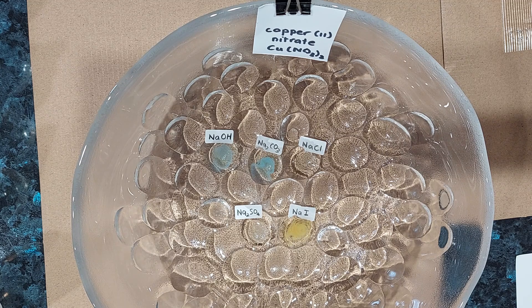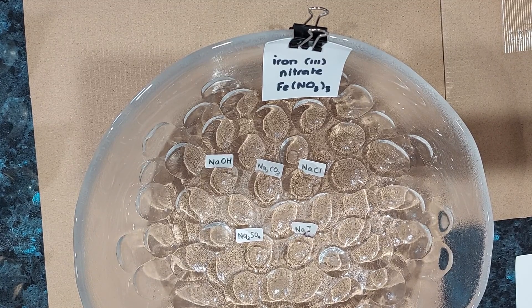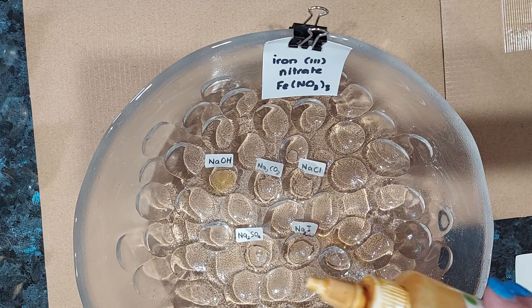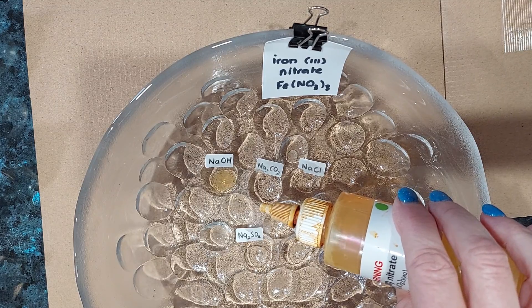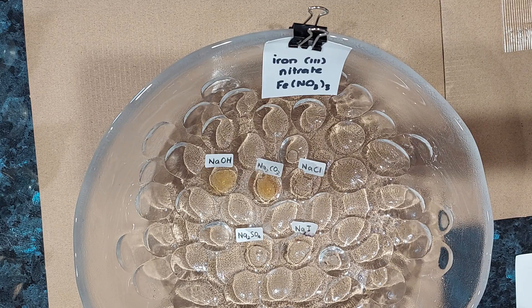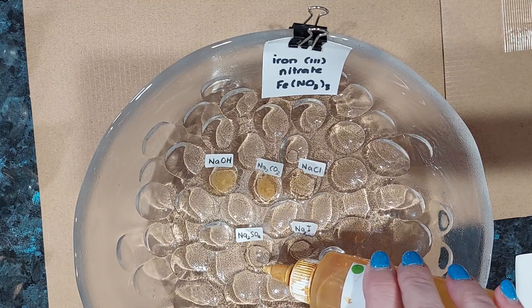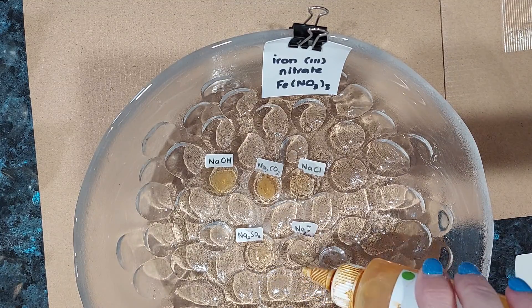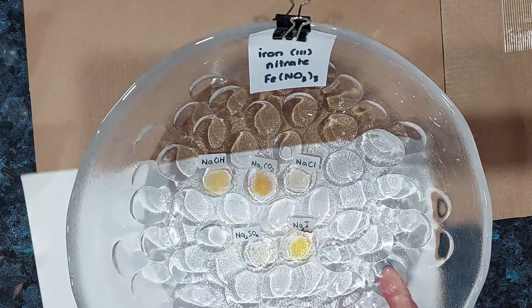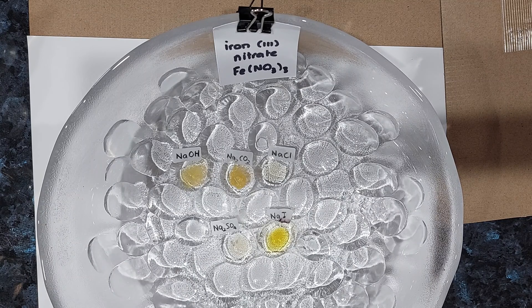And sodium iodide with copper(II) nitrate — there's a yellow-brown precipitate appearing with that one. Now iron(III) nitrate's turn. With sodium hydroxide, it's going a little bit cloudy. Sodium carbonate — definitely a cloudy precipitate, and I can see the sodium hydroxide is quite cloudy now too. Sodium chloride and sodium sulfate — nothing. I'll put a white background underneath so you can see more clearly that we do have a precipitate with sodium hydroxide and sodium carbonate.